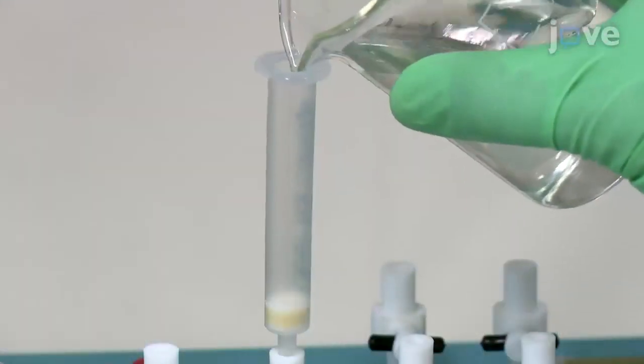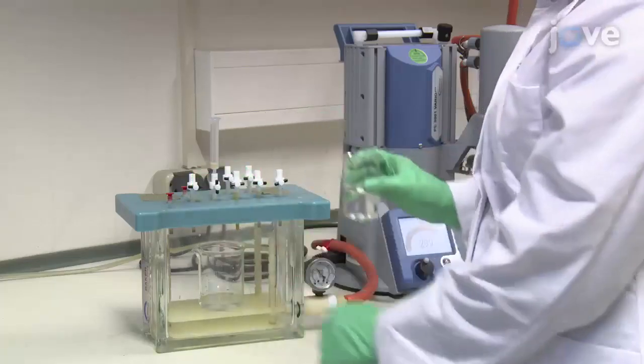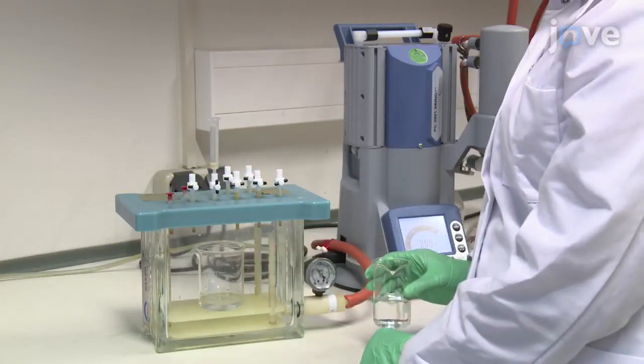After the water has left the cartridge, apply the filtrate and use a diaphragm pump or other moderate vacuum to increase the flow velocity. The pre-concentration is very important.